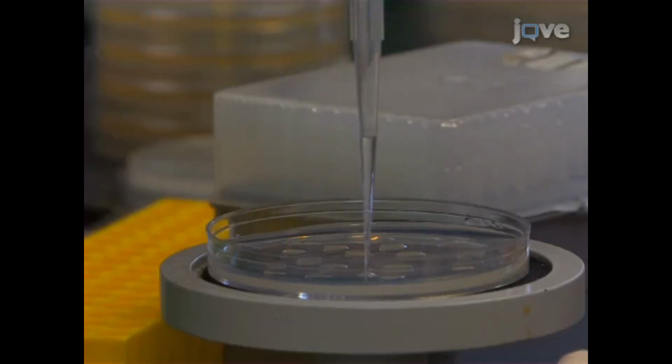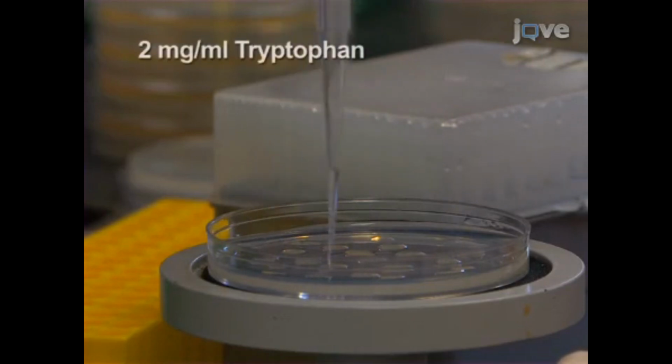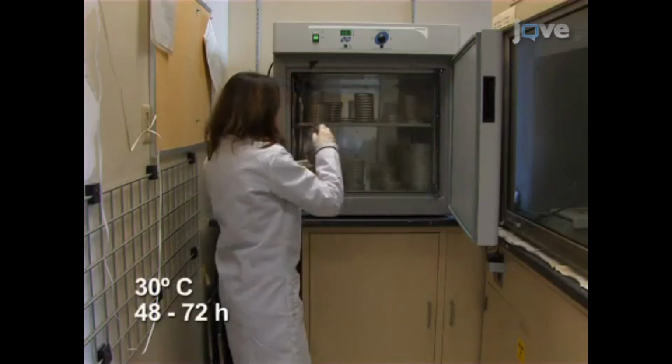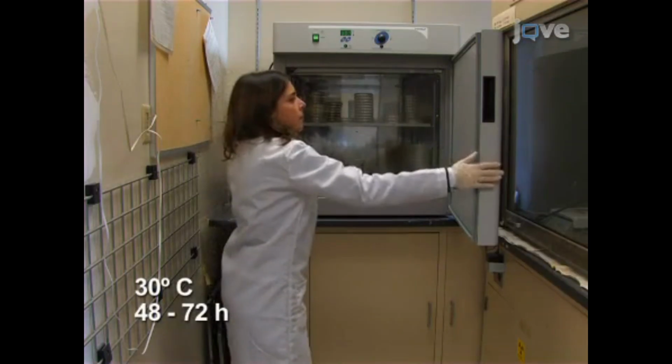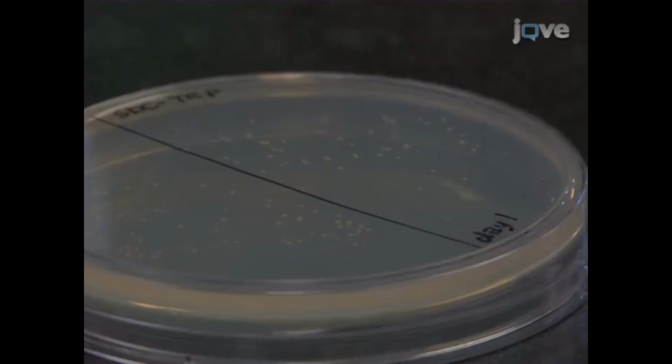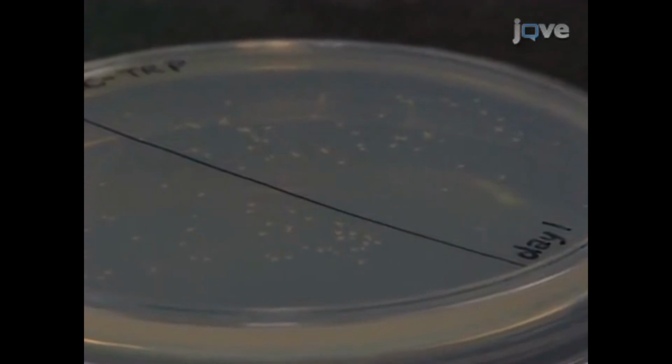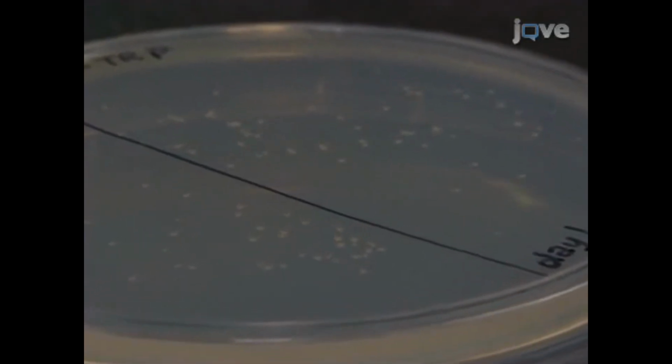On the day of plating, and every 2 days subsequently, remove 1 plate and dropwise add 0.5 milliliters of tryptophan to allow viable cells to grow. Incubate the plate at 30 degrees Celsius for an additional 48 to 72 hours. After 48 to 72 hours, count the CFU for the viability for the day of tryptophan addition.